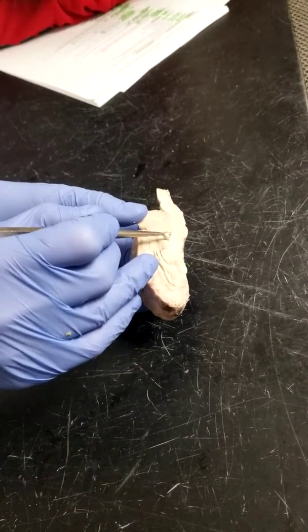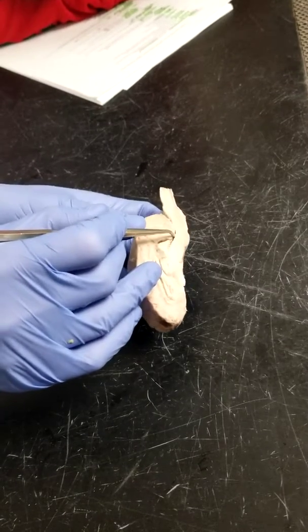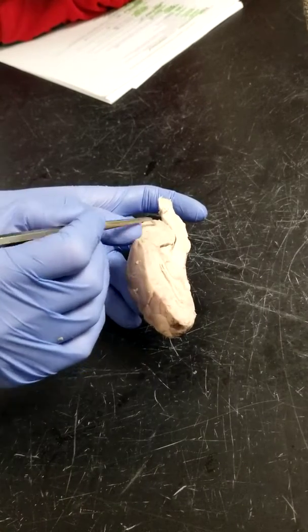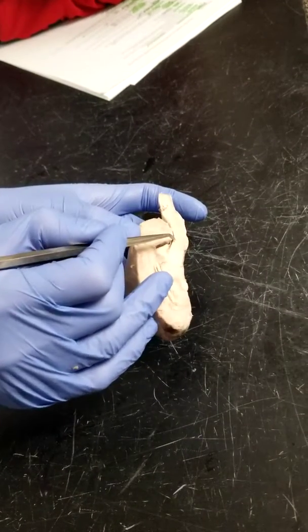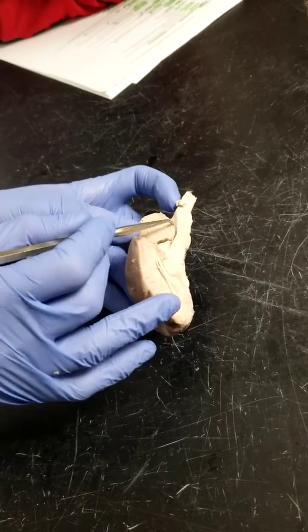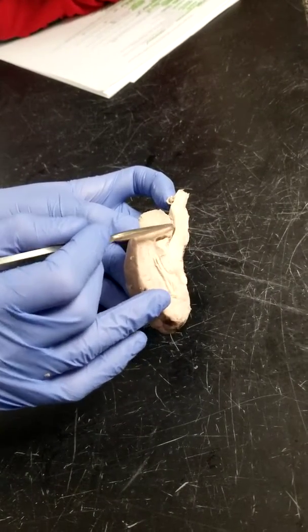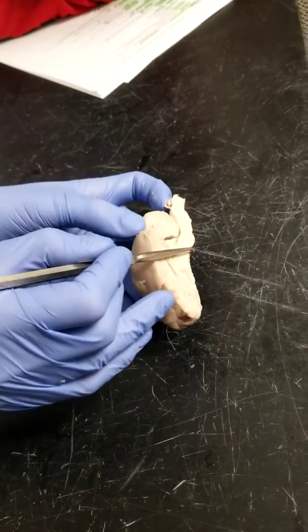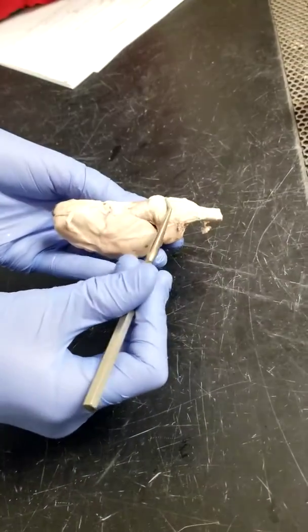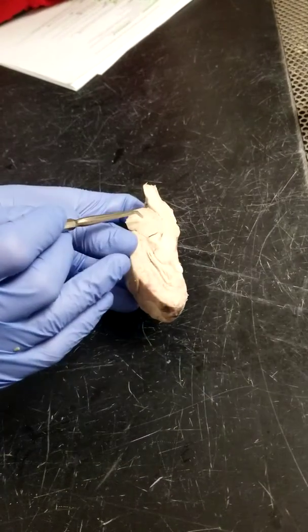If you follow that cerebral aqueduct, once you're underneath or inferior to the cerebellum, that's when you're going to be in the fourth ventricle. So here we're in the fourth ventricle. And the fourth ventricle sits again between that and the cerebellum. And look at this prominence here. That's the pons. So we've got pons, cerebellum.